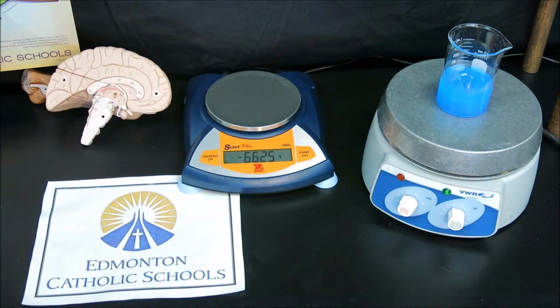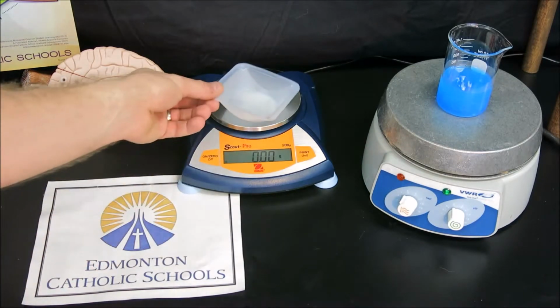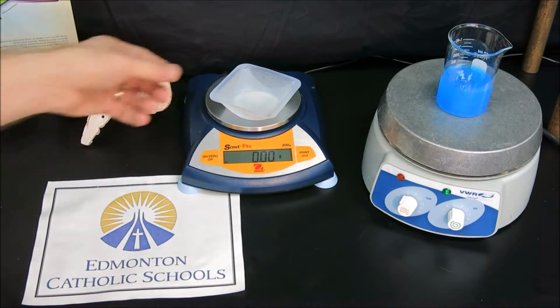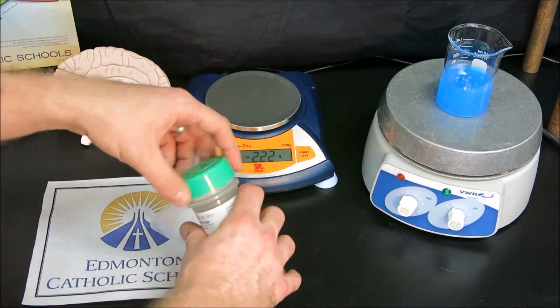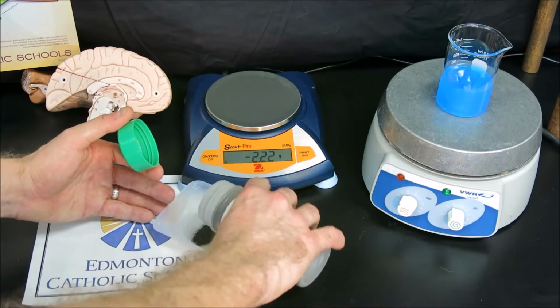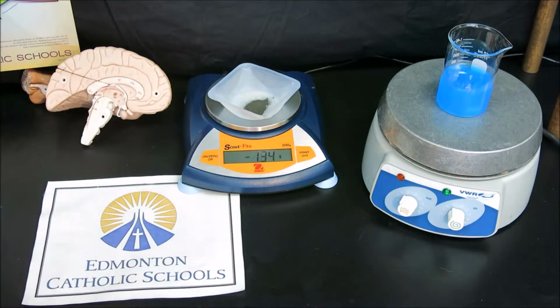While that's stirring, we'll take the time to weigh out the iron that we'll be adding to this reaction by again taring the scale, this time placing the weigh boat on, taring it once more, and now weighing out 2 grams of the iron, in this case filings, into the weigh boat. Now, weighing out iron filings is not as easy with the shaker bottle instead of a scoopula, so I will pour in what I think is 2 grams or more, and we can use the scoopula to scoop out excess iron filings into a separate weigh boat designed for excess iron.